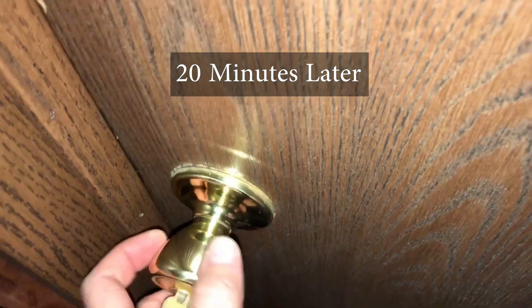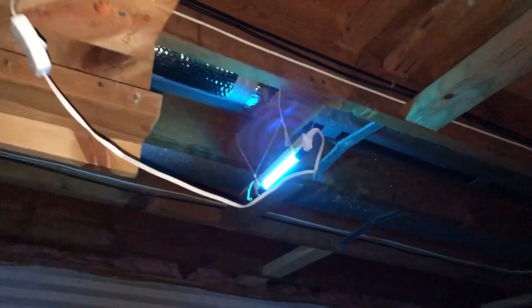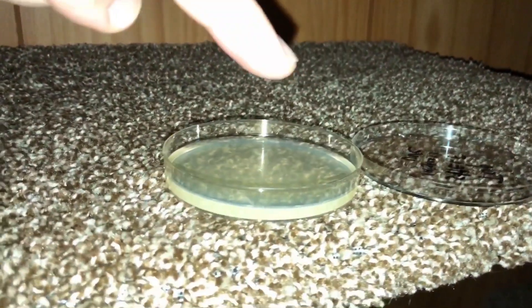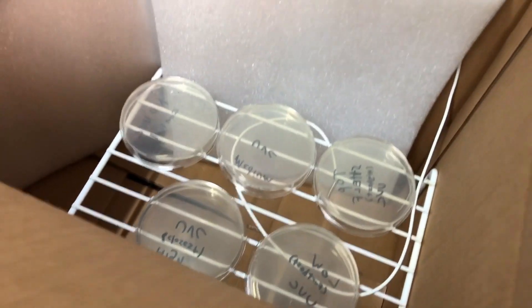Time is up. Let's turn off the UV light so I'm not giving myself cataracts. I also added a fourth dish right up at the top closest to the light, giving me four tiers total. All dishes are inside the incubator — we'll close this up and come back in a couple days.